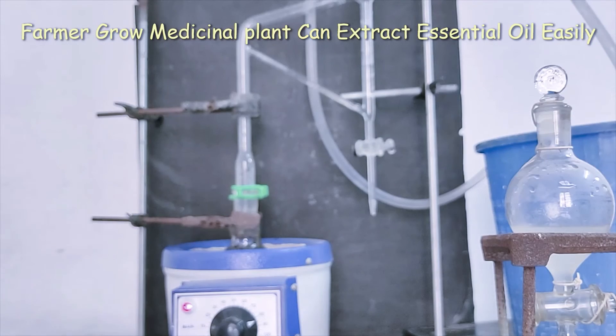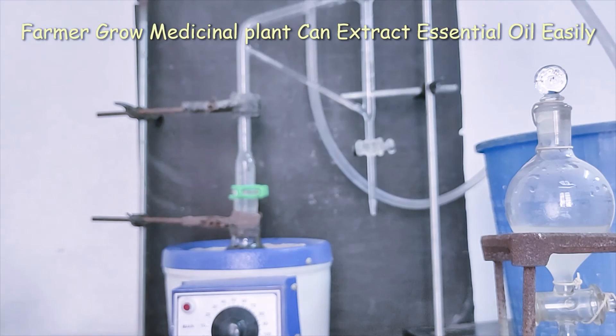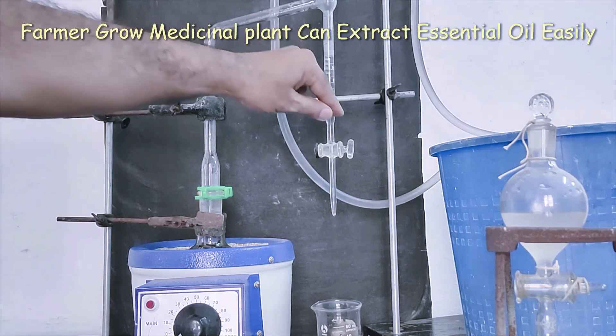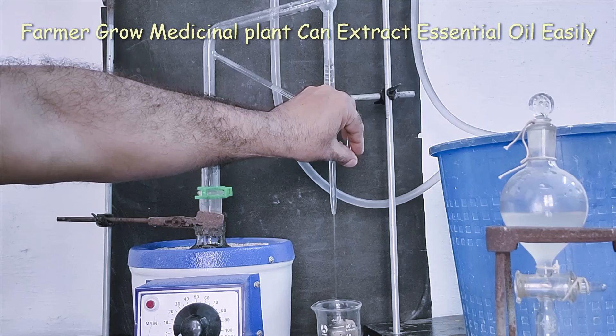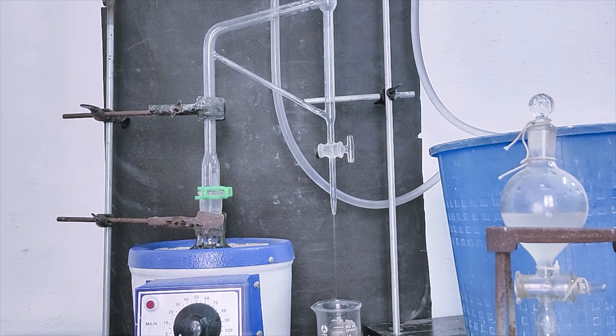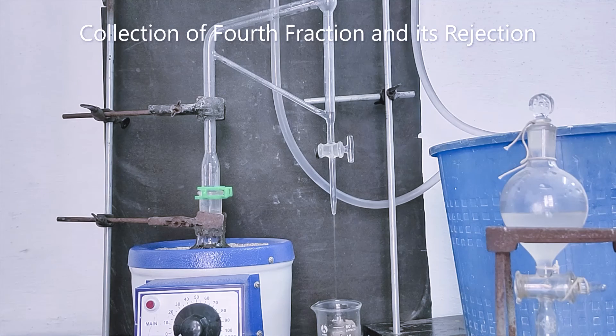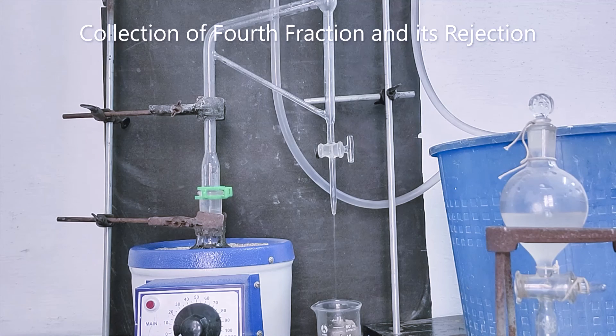Now I am going to stop the heating mantle. Now I am collecting fourth fraction. Because condensation and evaporation process is continued.